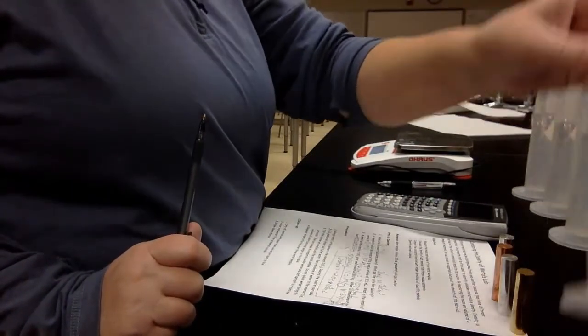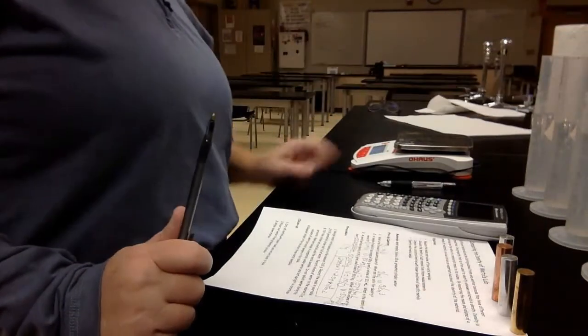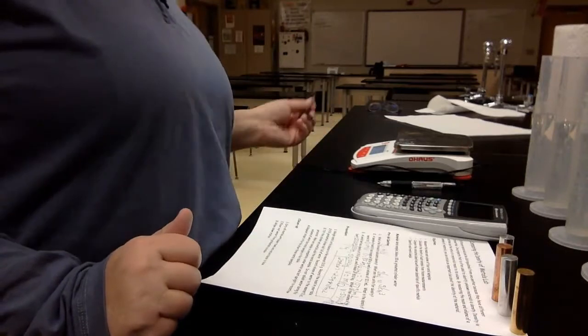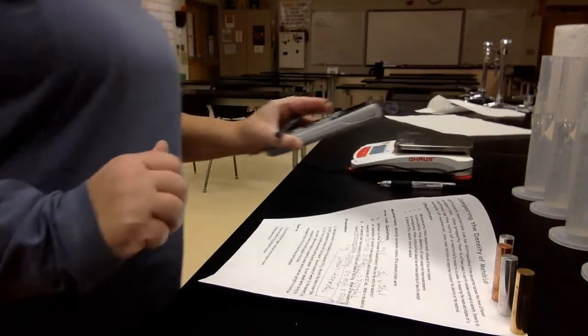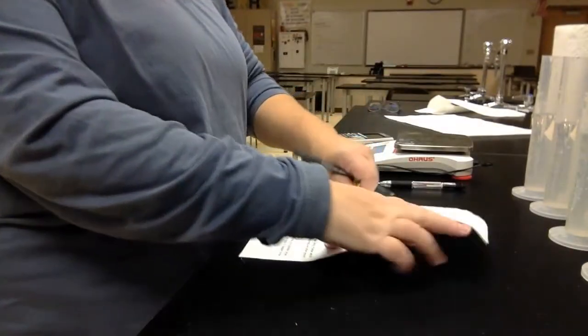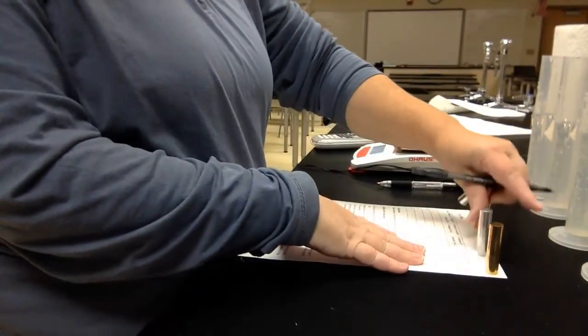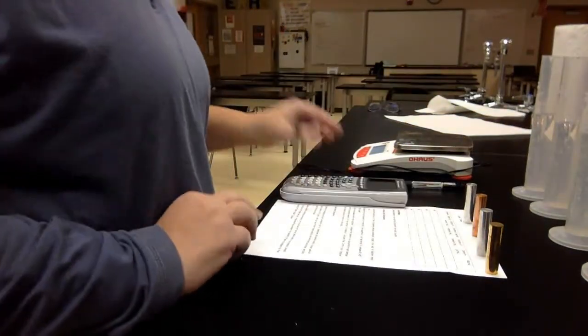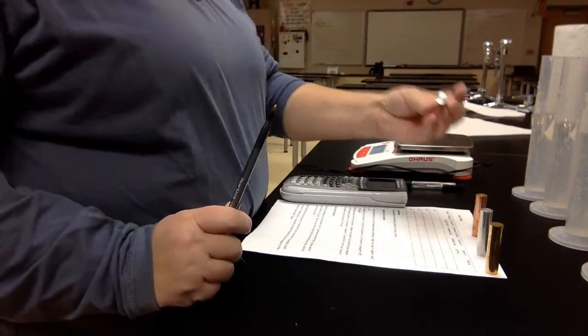Who wants to watch me make a mess all over the table? So I have 1 for each of my metals. Then I'm going to dry everything, and we'll figure out all of our work. So let me flip this over. Okay, on my data table, put my metals here to help hold my paper down. So mass 1, I'm going to do this nice shiny one.